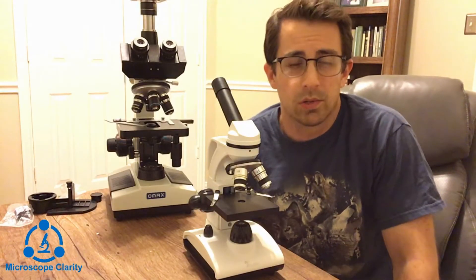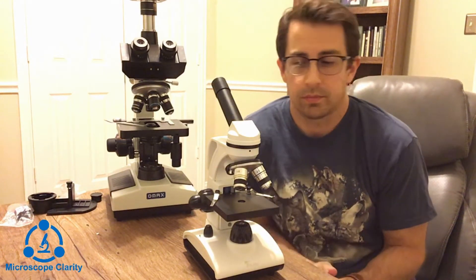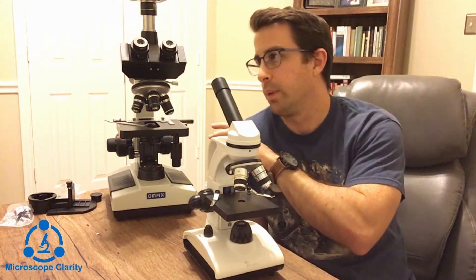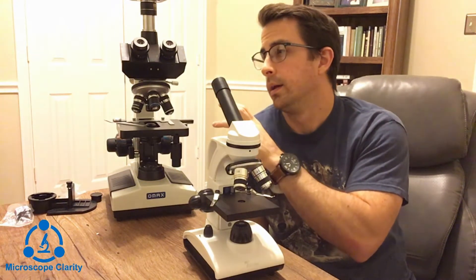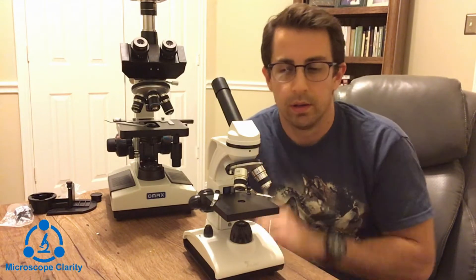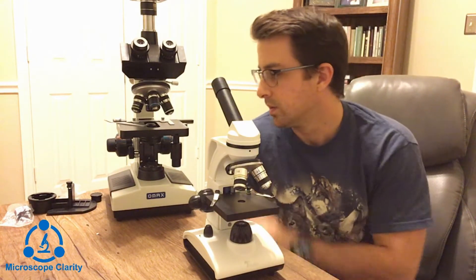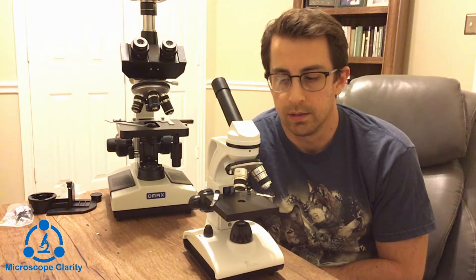Hey guys, it's Brandon here from microscopeclarity.com. Today we're going to be going through the parts of a compound microscope. I have two microscopes here — a more simple compound biological microscope, and a more complex trinocular biological microscope. This one is a monocular biological microscope. We'll go through the parts separately; some parts are the same and some are different.